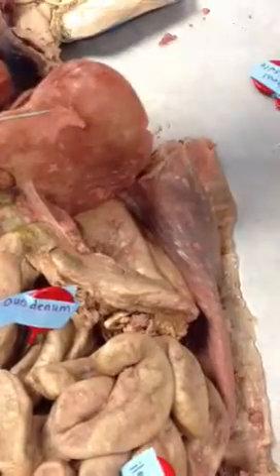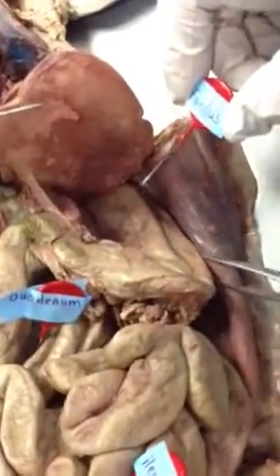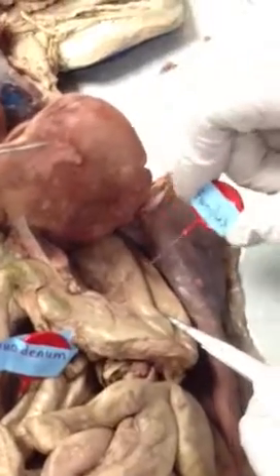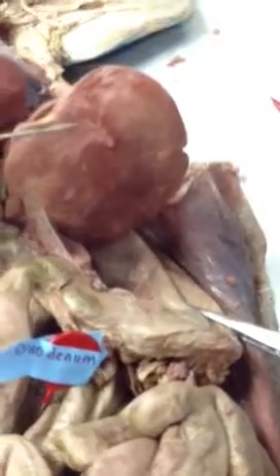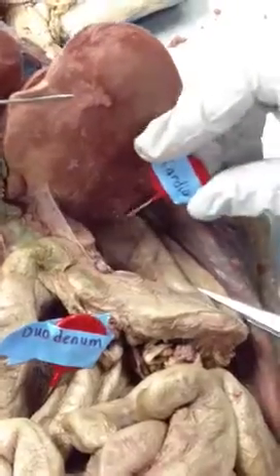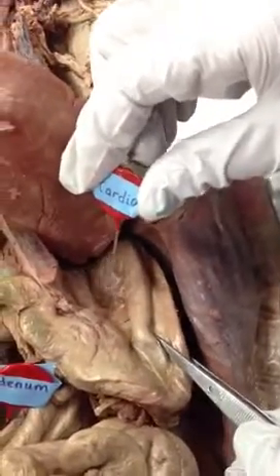If we come up here, the fundus is this top portion where the stomach expands when you have to store extra food. So the fundus is the top part after the esophagus entry. The part right by where the esophagus enters is the cardia, which will be right up in this area. It's going to be really far up there towards the top, and then it goes into the fundus that we just talked about.